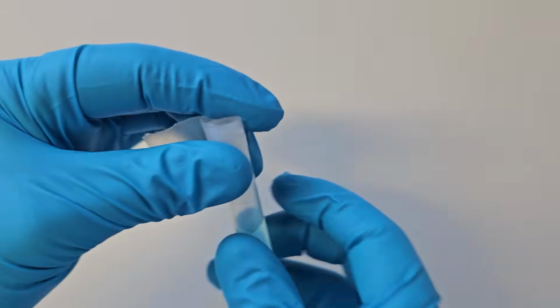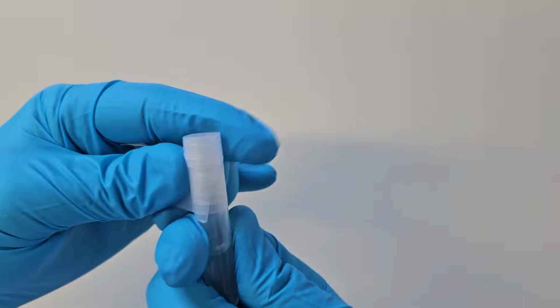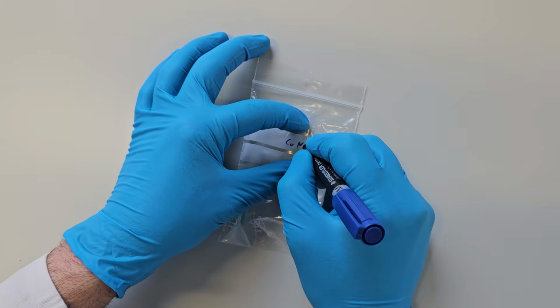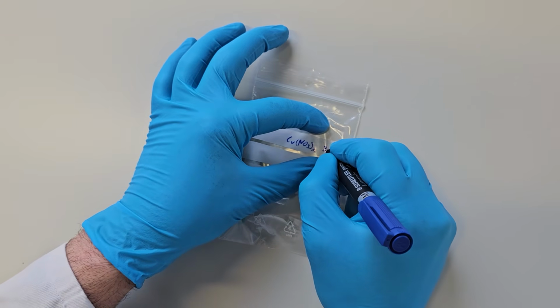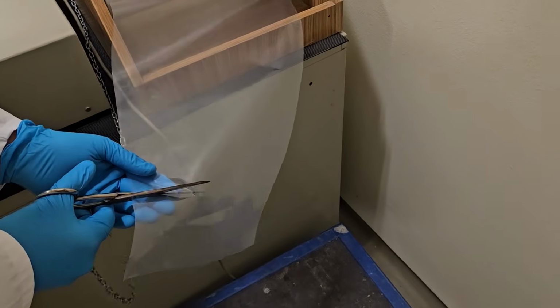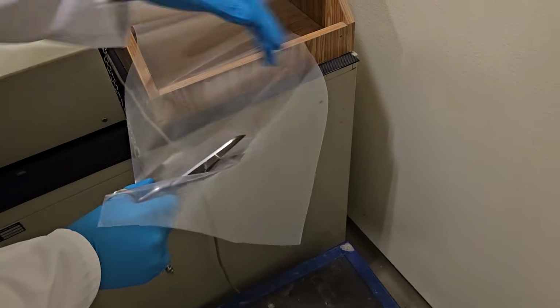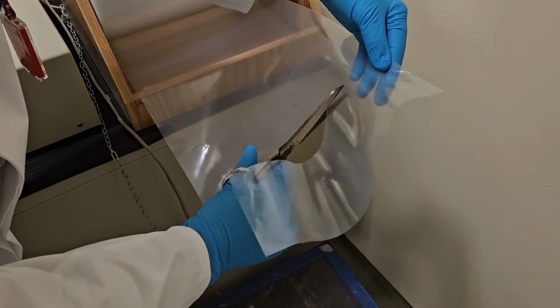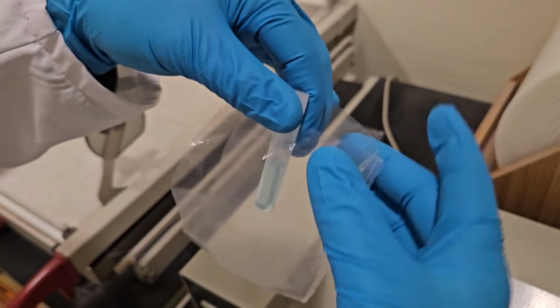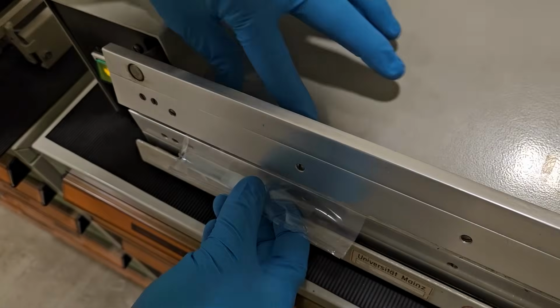So first off, a bit of behind the scenes stuff: the preparation for the irradiation. Here we see the person conducting the test wrapping the copper standard for irradiation. It's quite cool to see that A, as a student doing the experiment, you don't notice this happening, and B, the irradiation of liquids requires slightly different packaging than that of solids. The sample has to be shrink wrapped.